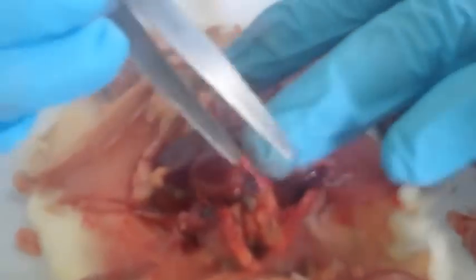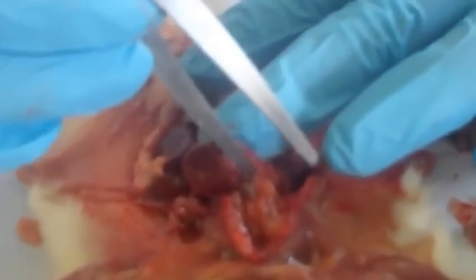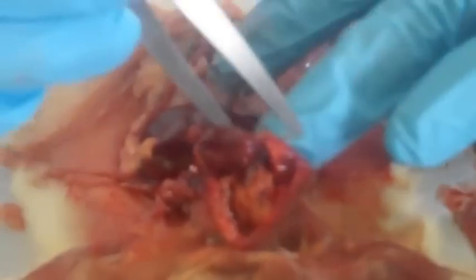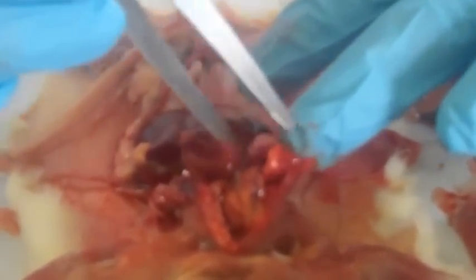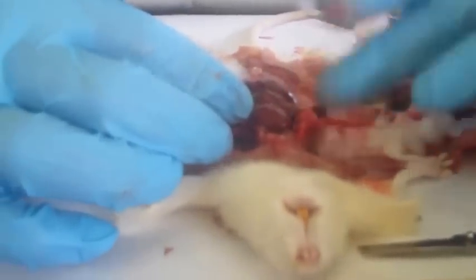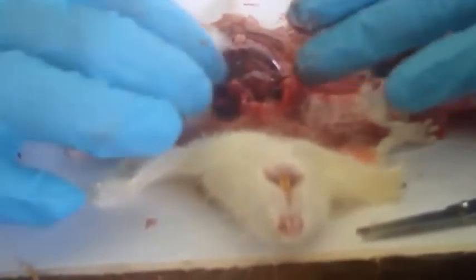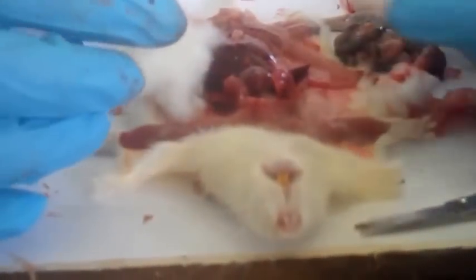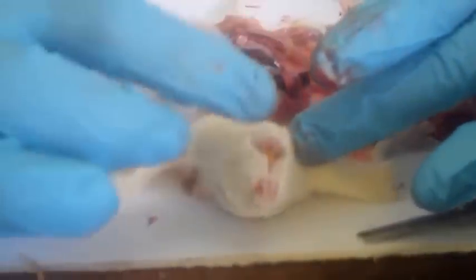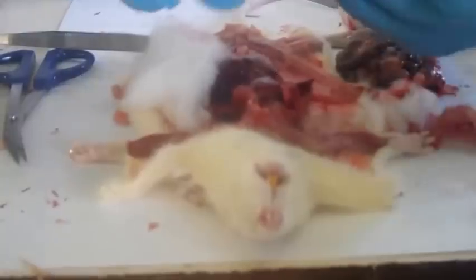We displace a little to the left of the specimen. We can see the trachea down that will branch into the lungs. Then, yeah, so these are the lungs. The one on the right has got 3 lobes, and the one on the left is just a single lung. So now we are going to look at the head region, especially the mouth. We are going to dissect and see what features are inside.